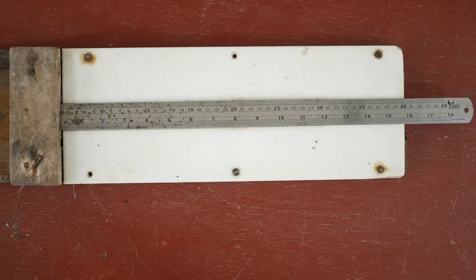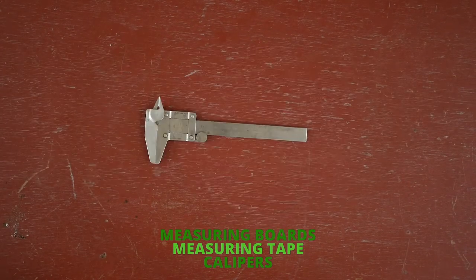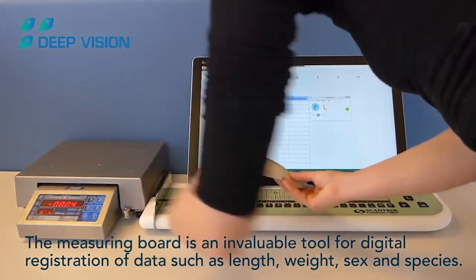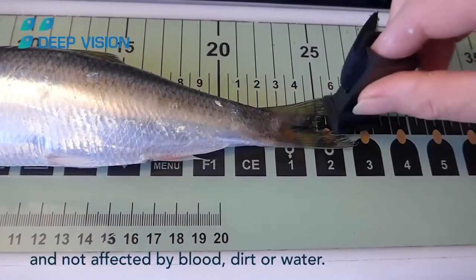To better illustrate the considerations mentioned so far, let us first proceed with the actual process of measuring fish lengths. Before going to the field or working in a laboratory, the measuring and recording tools should be prepared ahead of time. Measurements are made with special measuring boards, rulers, tapes, and calipers. There are also electronic measuring boards that utilize barcoding to hasten the process when dealing with numerous samples.